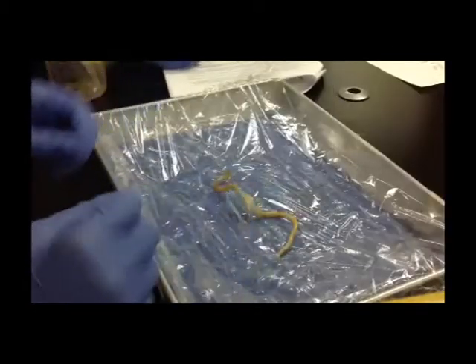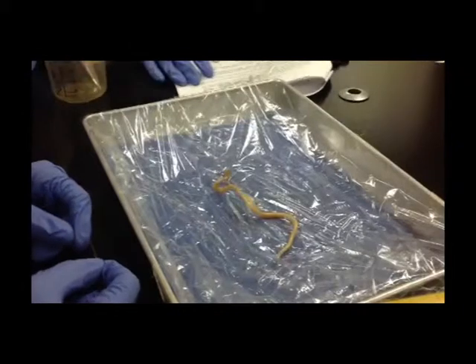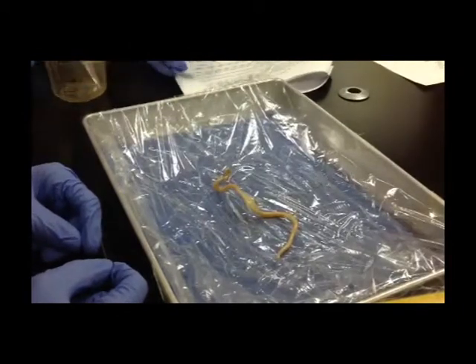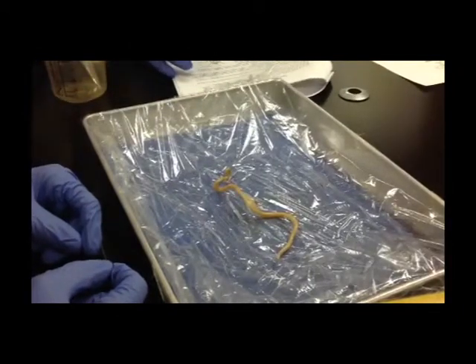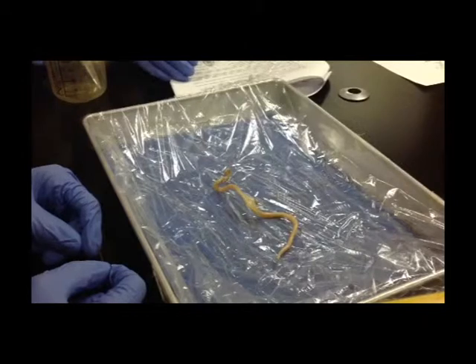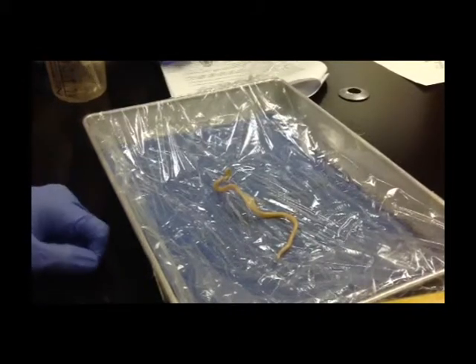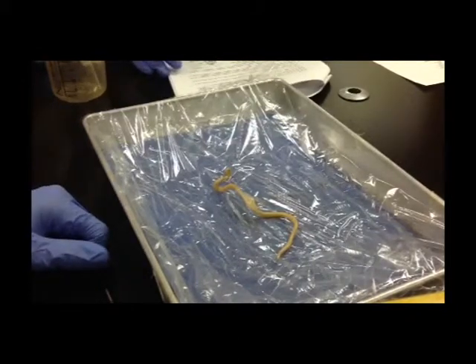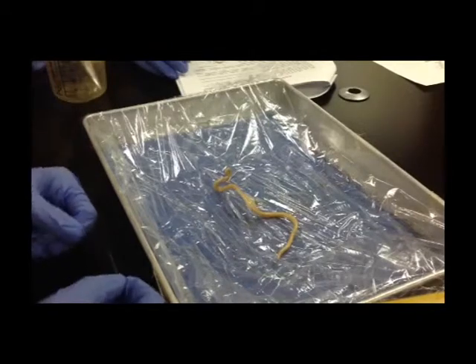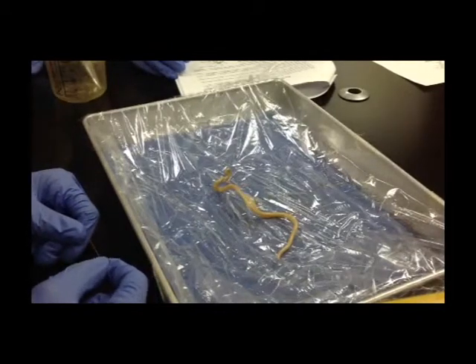We will be dissecting a tapeworm, and since we do not have a tapeworm dissection guide, we will be using the earthworm dissection guide. Given our limitations, we will attempt to show you as much of a tapeworm as we can. The first thing we are going to do is identify the anterior and posterior ends.